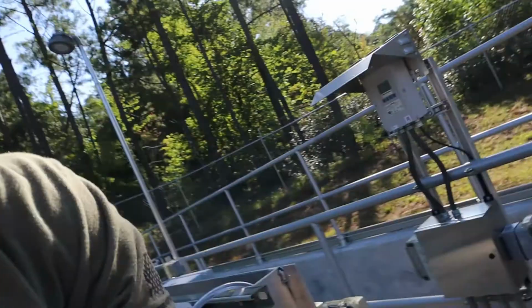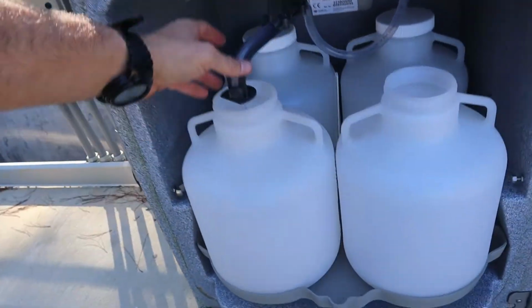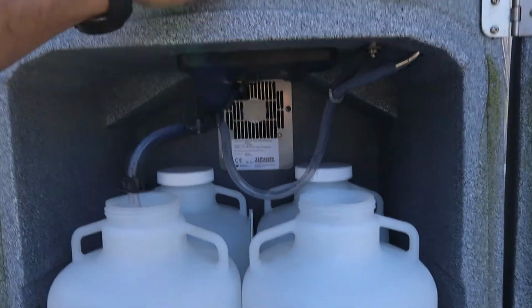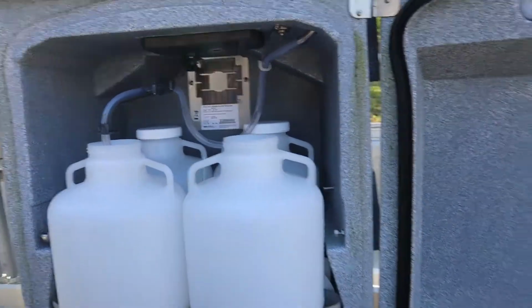Alright, so what we're going to do first is I'm going to open our sampler, make sure that we have our carboys in place, make sure that it is over the carboy that we want to pour our sample into. Now it's very cold in here. I have it set at less than 6 degrees Celsius up here. Pro tip.